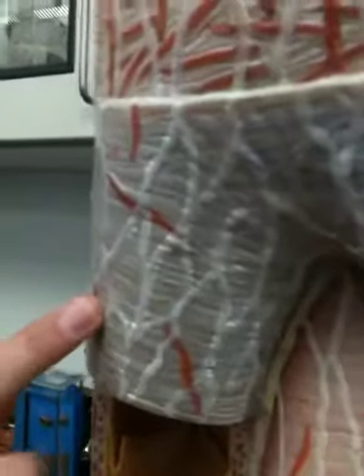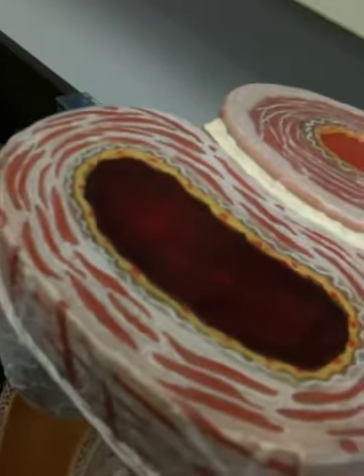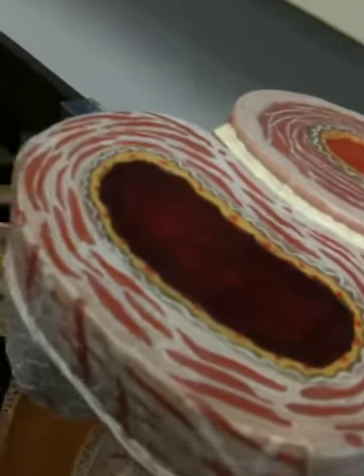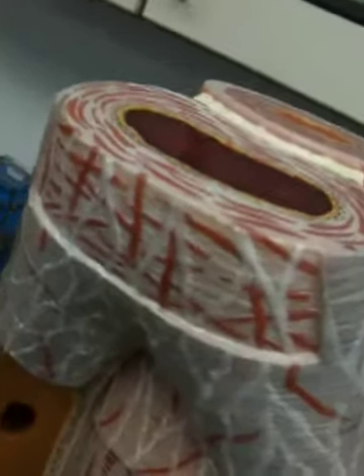The tunica externa is made out of areolar and fibrous connective tissue. So it's this part. Tunica media has smooth muscle and elastic fibers. I take it that these kinds of things are elastic fibers. Yeah. And the tunica interna has the endothelium and the basal lamina. And so again, the tunica media is connective tissue, so the areolar and fibrous, yes, right?